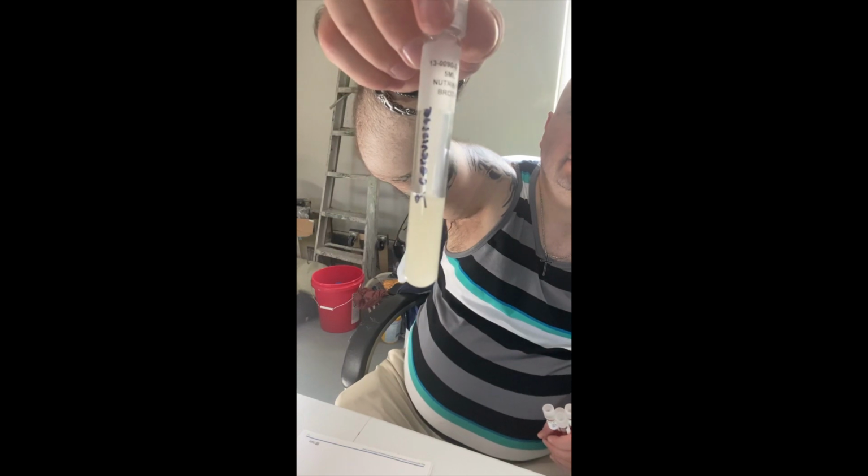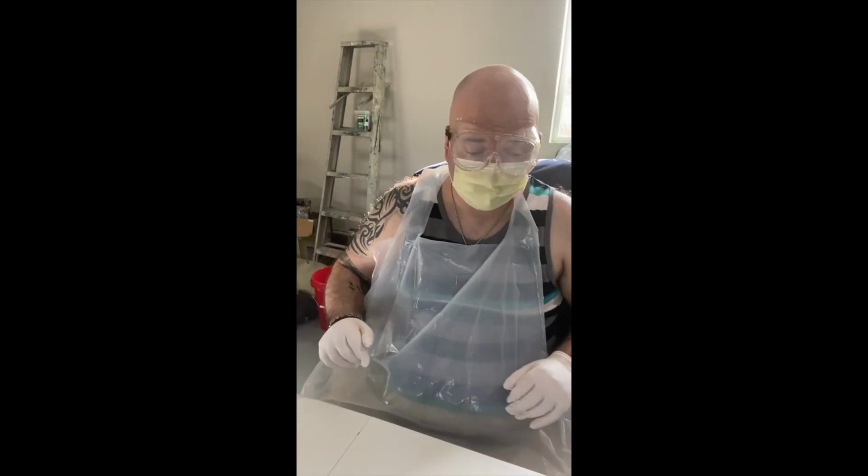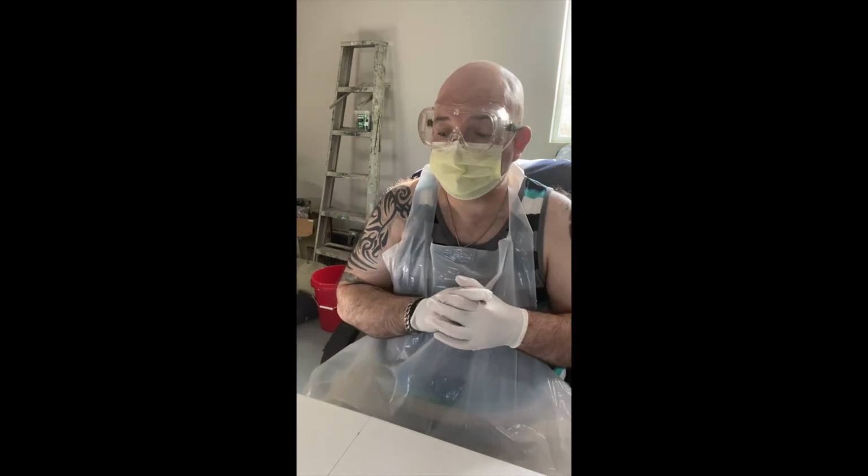I have my S. cerevisiae culture, S. epidermidis culture, T-lights, and I believe that's it. So I'm going to finish putting these tubes away, put on my PPE, and then we will get started with the experiment. All right, so the first thing I'm going to do is add the sugars to each of my pairs of tubes.